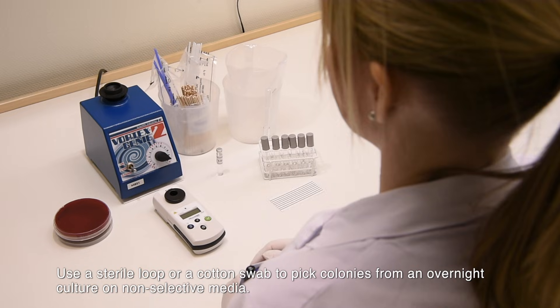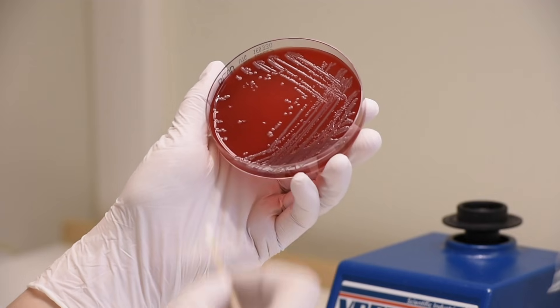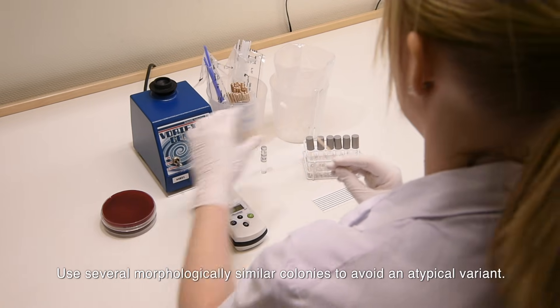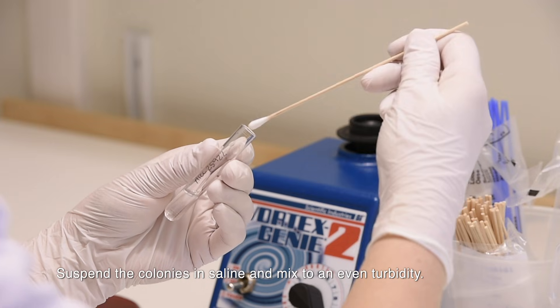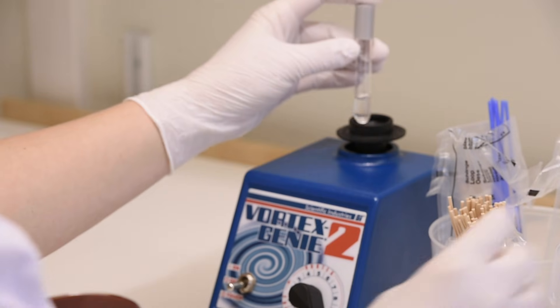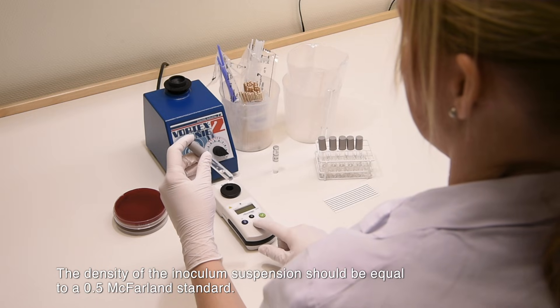Use a sterile loop or a cotton swab to pick colonies from an overnight culture on non-selective media. Use several morphologically similar colonies to avoid an atypical variant. Suspend the colonies in saline and mix to an even turbidity. The density of the inoculum suspension should be equal to 0.5 McFarland standard.